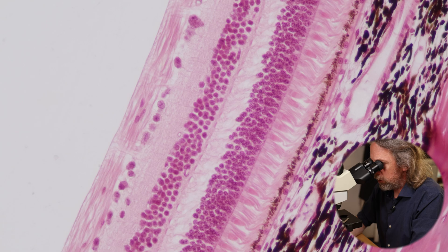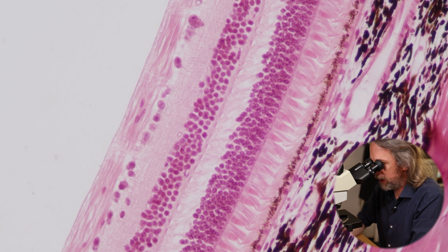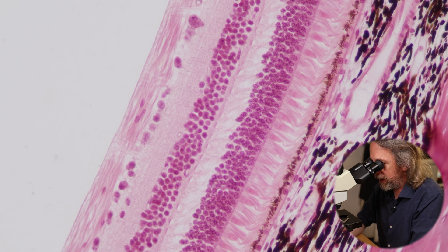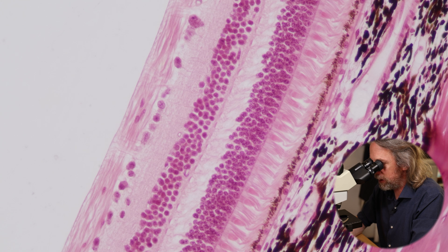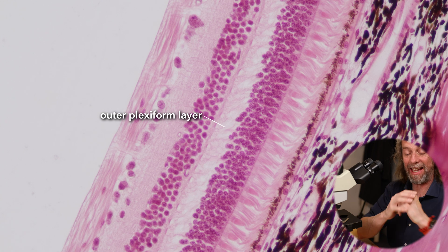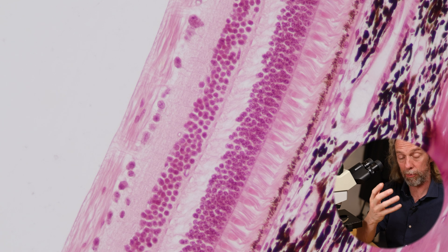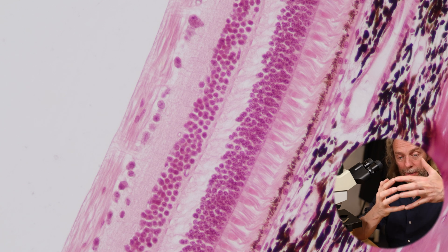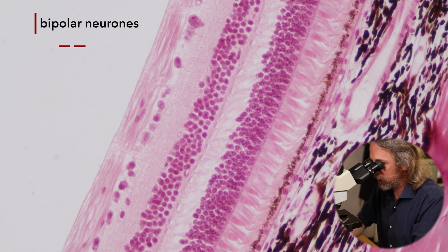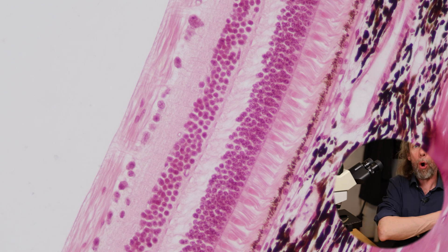Next to the layer of all of those nuclei, we can see another layer - and that looks like cytoplasmic processes in there, looks a bit nervy. This is the outer plexiform layer. What we're seeing in there are processes of the photoreceptor cells - processes of the rods and cones - synapsing with processes of intermediate neurons.